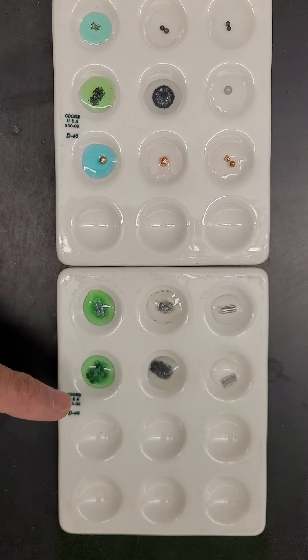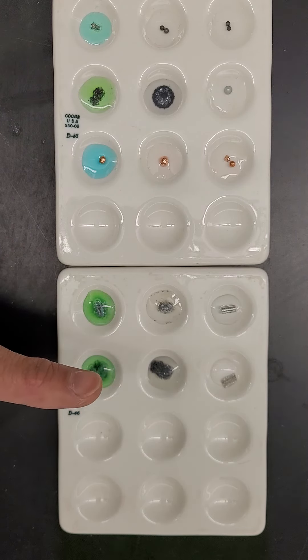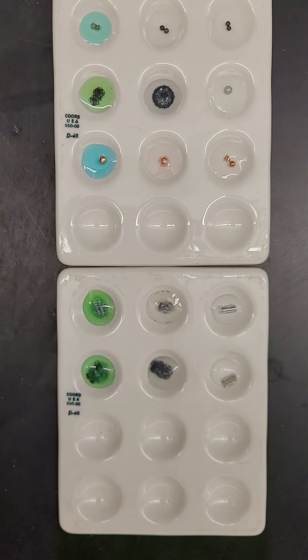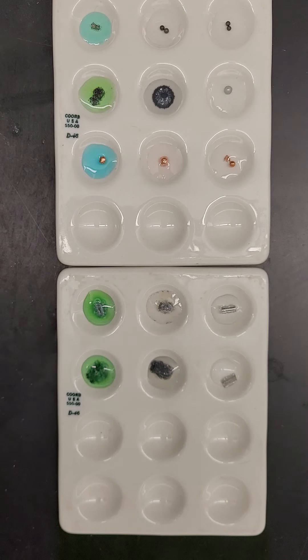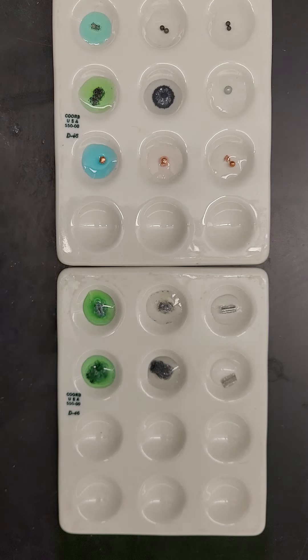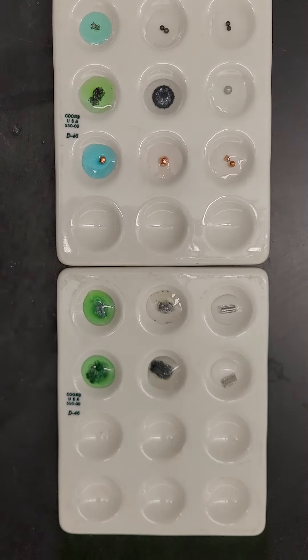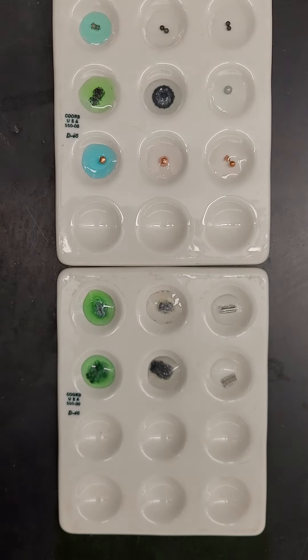The last column is magnesium. It looks like there are no changes for the first row. A lot of bubbles, color change, and structural change are now completely different for both the middle and the last row. So magnesium with lead nitrate and magnesium with copper nitrate show some significant changes as well. That is your data.